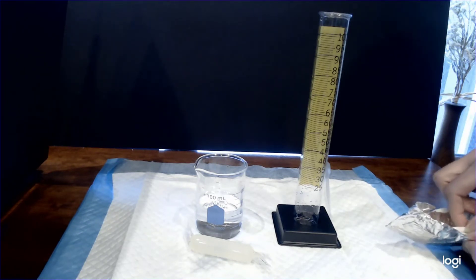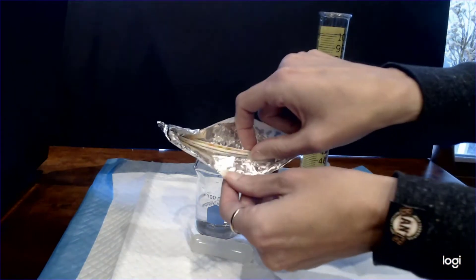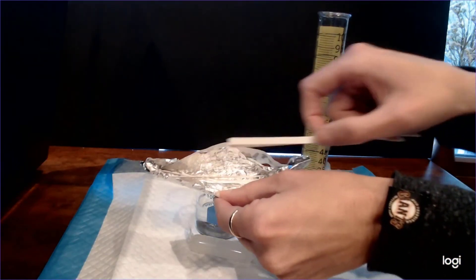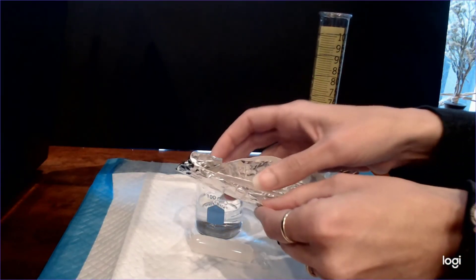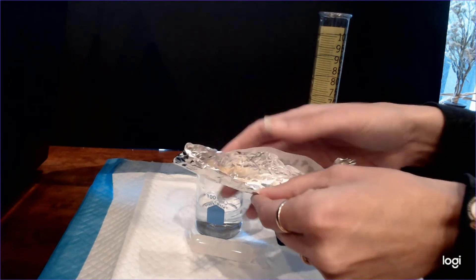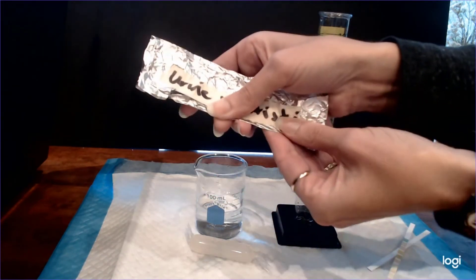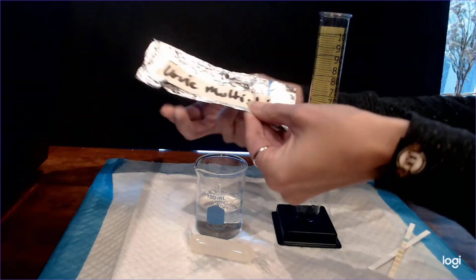Now there are I think about eight of them but you'll only need two for this experiment, so go ahead and pull out two of them and then make sure you seal that foil back up tightly and put it away somewhere where it's not exposed to light, otherwise they go bad.